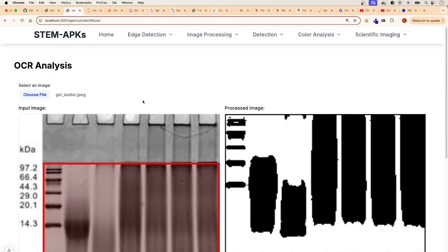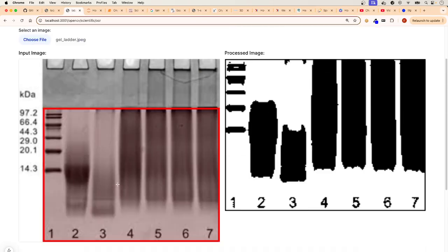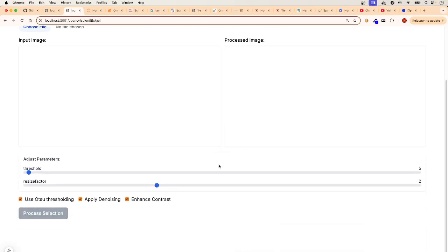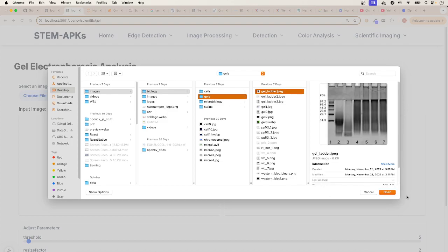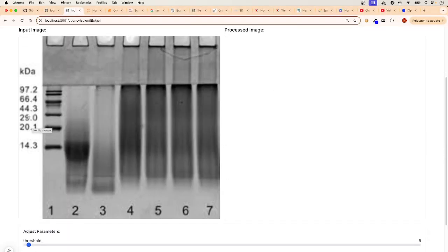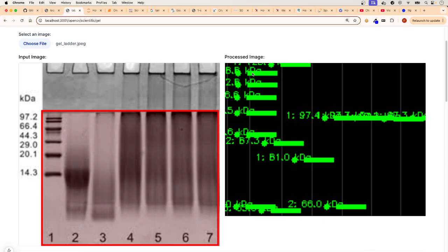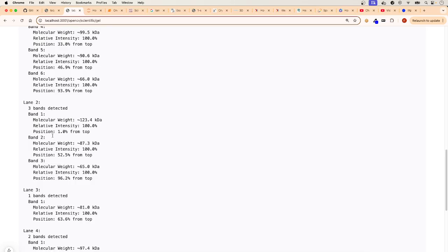Actually, this is OCR analysis. I was wondering, what's going on here? That's the OCR analysis. That's not the one that I wanted. It's this guy. And then we choose file, same thing, same ladder, and then choose the area. You're not going to see the OCR applied now, but you still see Otsu there. Process the selection, and now it's creating the bands, right? And this is the summary that I was telling you about.